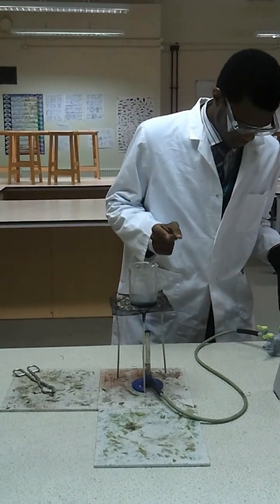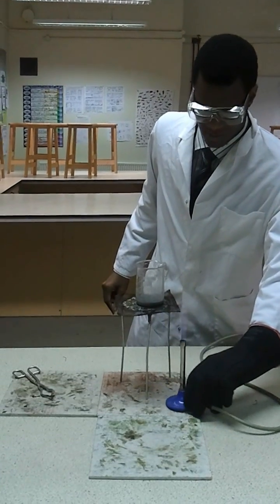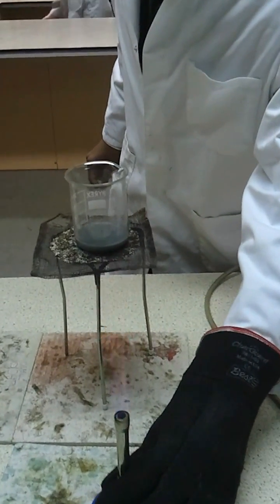And now I'm going to turn it off because it's beginning to boil. I'll just move this out of the way, turn it to a safety flame.